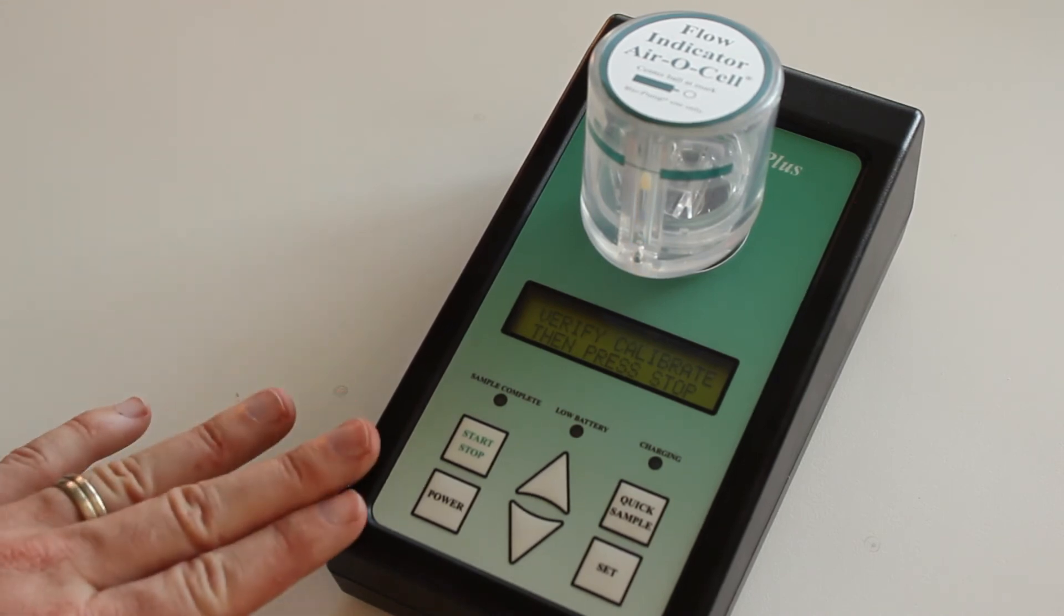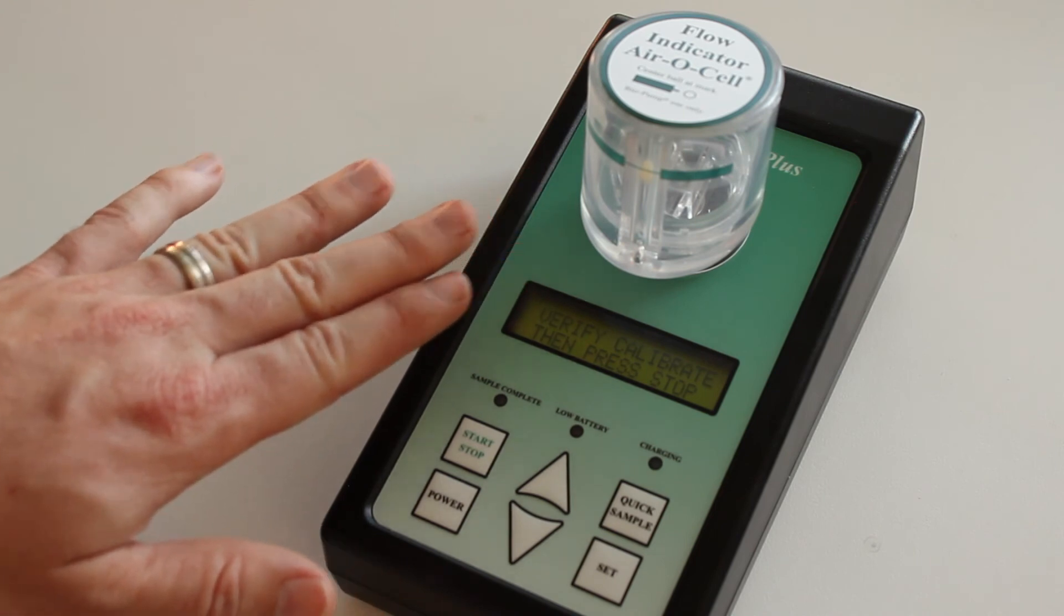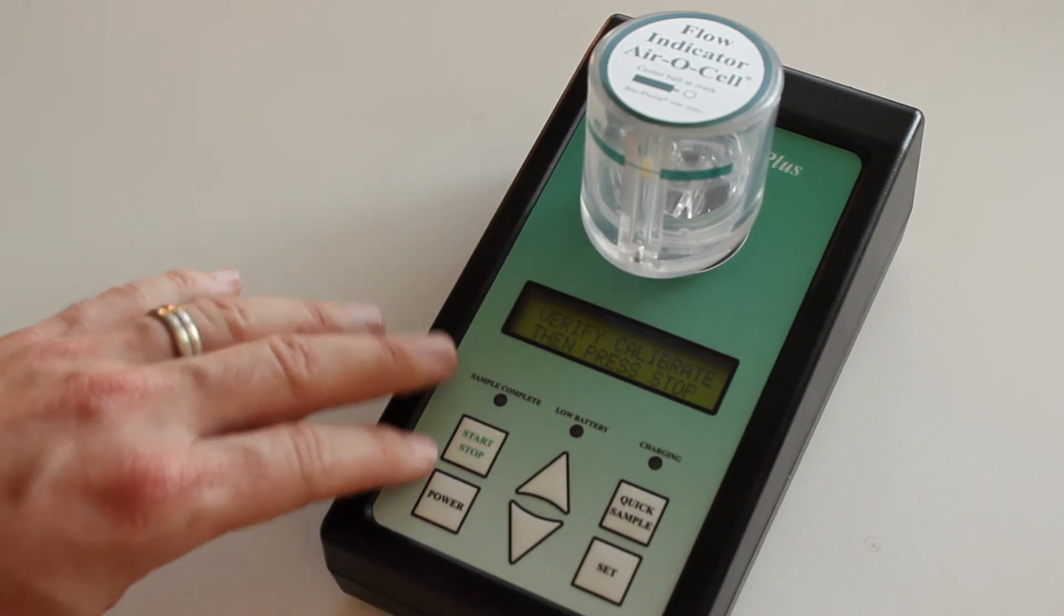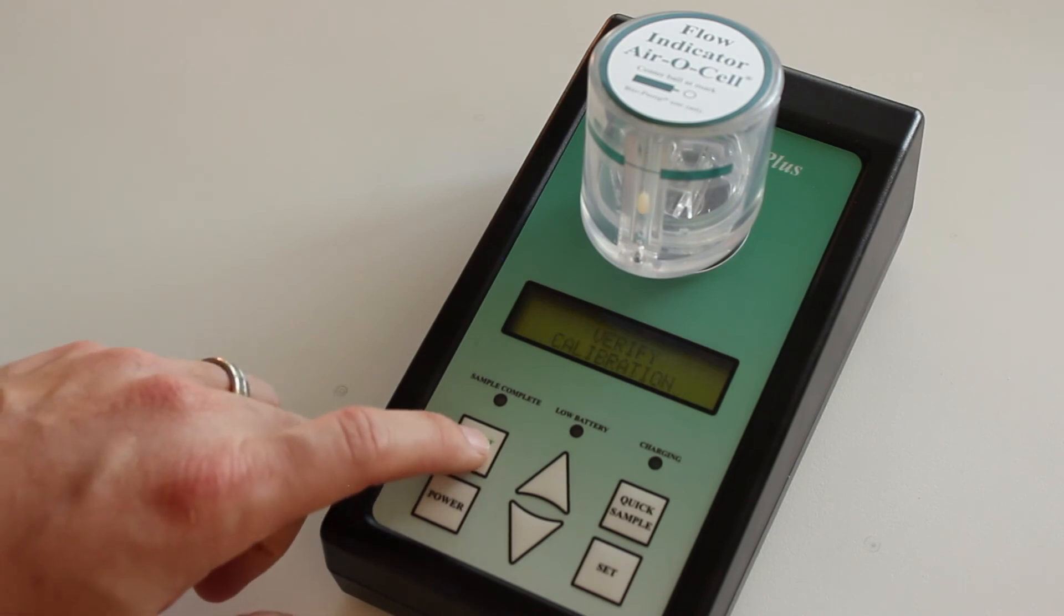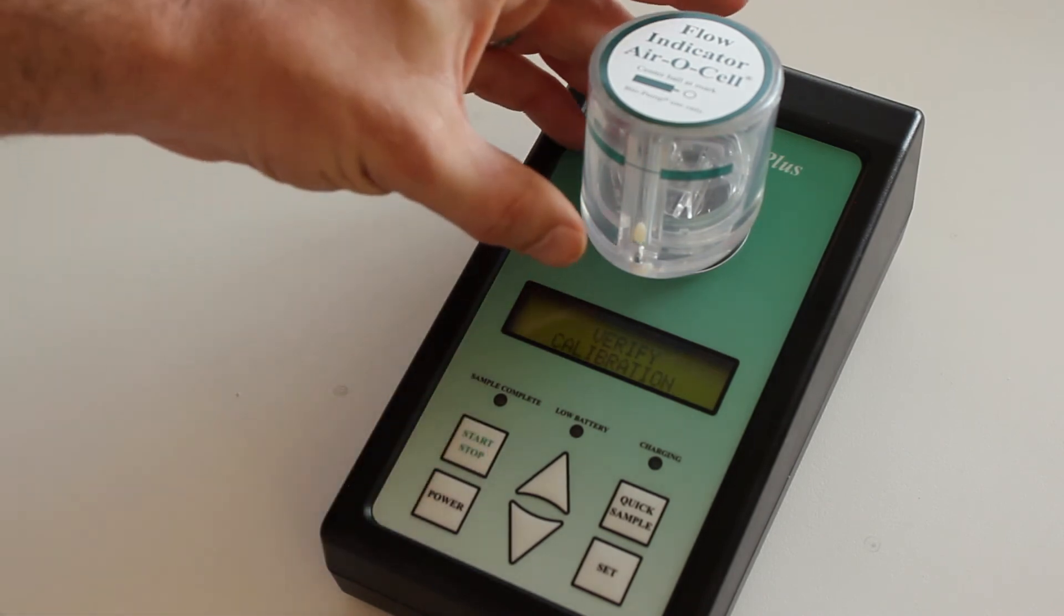Now to turn this off, once you're happy with it and it's all meeting what you're requiring, you can then press the start stop button and then you're good to go and start your day of sampling.